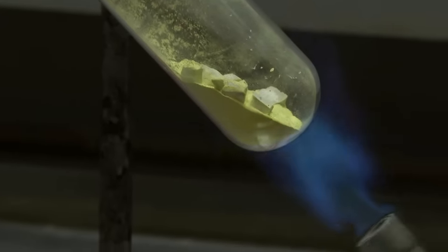There was a lot of swirling smoke, which presumably is a bromide of tungsten, probably tungsten tribromide. Eventually that wire burnt out as well. But it was clear that there was a reaction. And because bromine is a dense gas, it will displace the oxygen. So in the beaker, there was just bromine and no oxygen. And so I think it was quite a nice and quick demonstration of tungsten reacting with bromine.